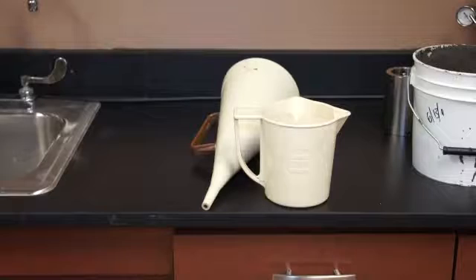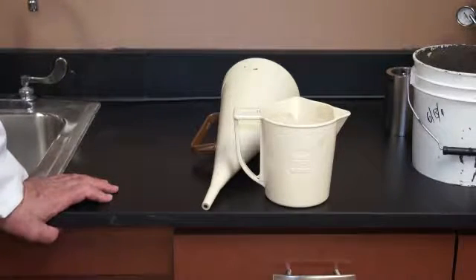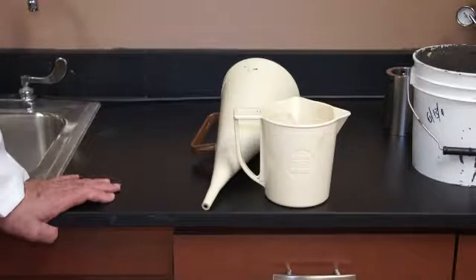At the end of the test, you want to report your results in seconds. And don't try to convert to centipoise or anything like that. In a previous life with another company that I worked for, we tried for about 5 years to correlate viscosity as measured in a funnel with viscosity as measured with a viscometer. You can't do it. You just absolutely cannot do it.